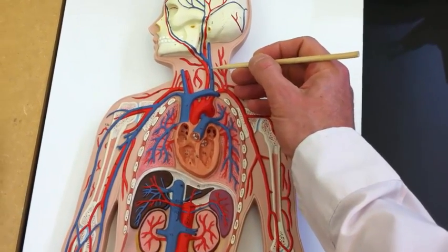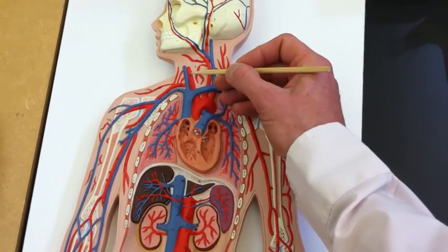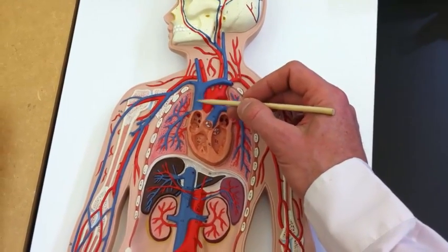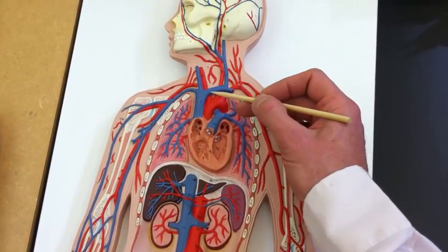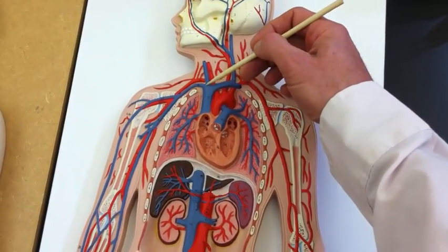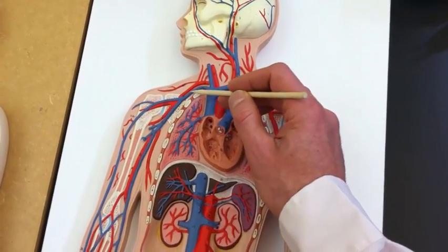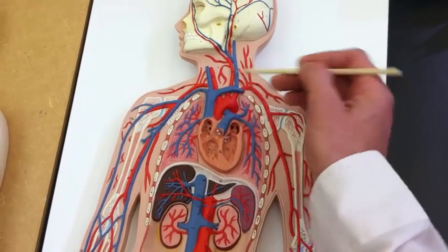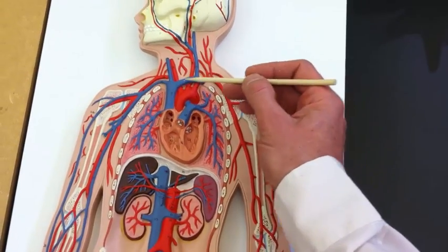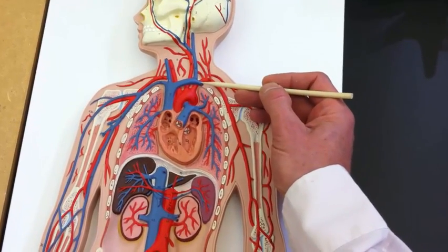This would be the jugular vein, and left jugular vein, and this would be left common carotid, right common carotid, right jugular vein. Here's the superior vena cava, and therefore this is the left brachiocephalic vein. This is supposed to be the left brachiocephalic vein, but it's not very long. And here we've got the right subclavian vein. Sorry, right brachiocephalic vein, if I said that wrong. And then over here, coming off of the left brachiocephalic vein, we've got the left subclavian vein.